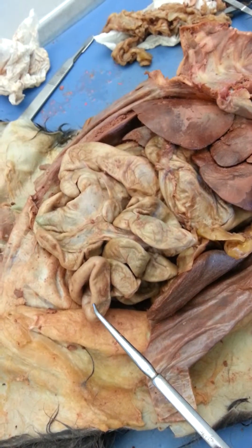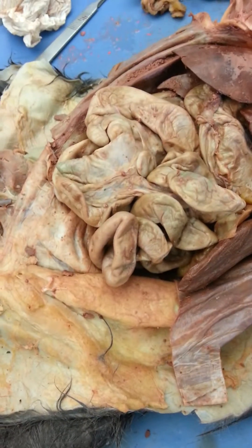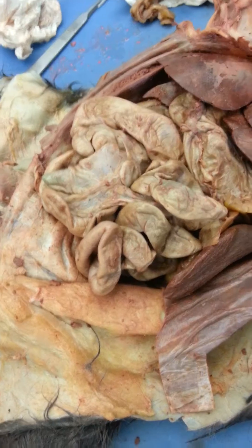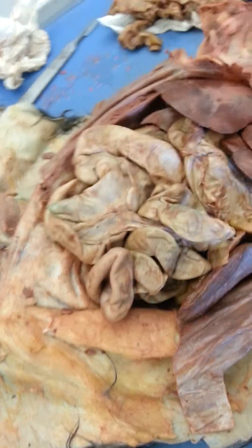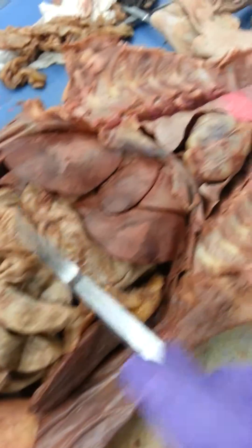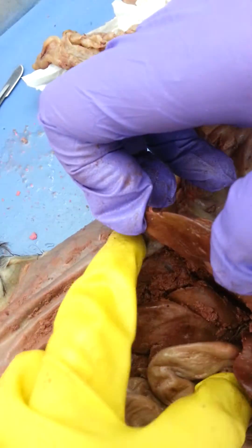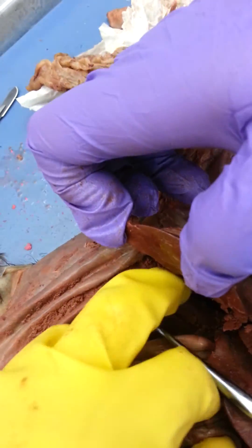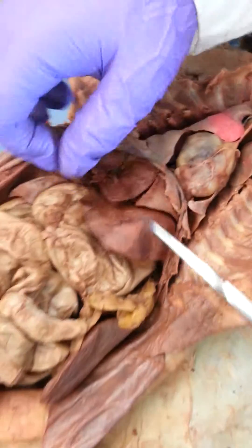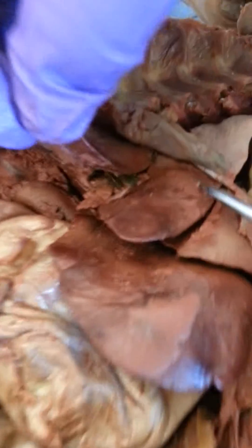And that'll go into the rectum. Here's the liver — six lobes of it. There are two behind and four in the front. The gallbladder is right here, in between.